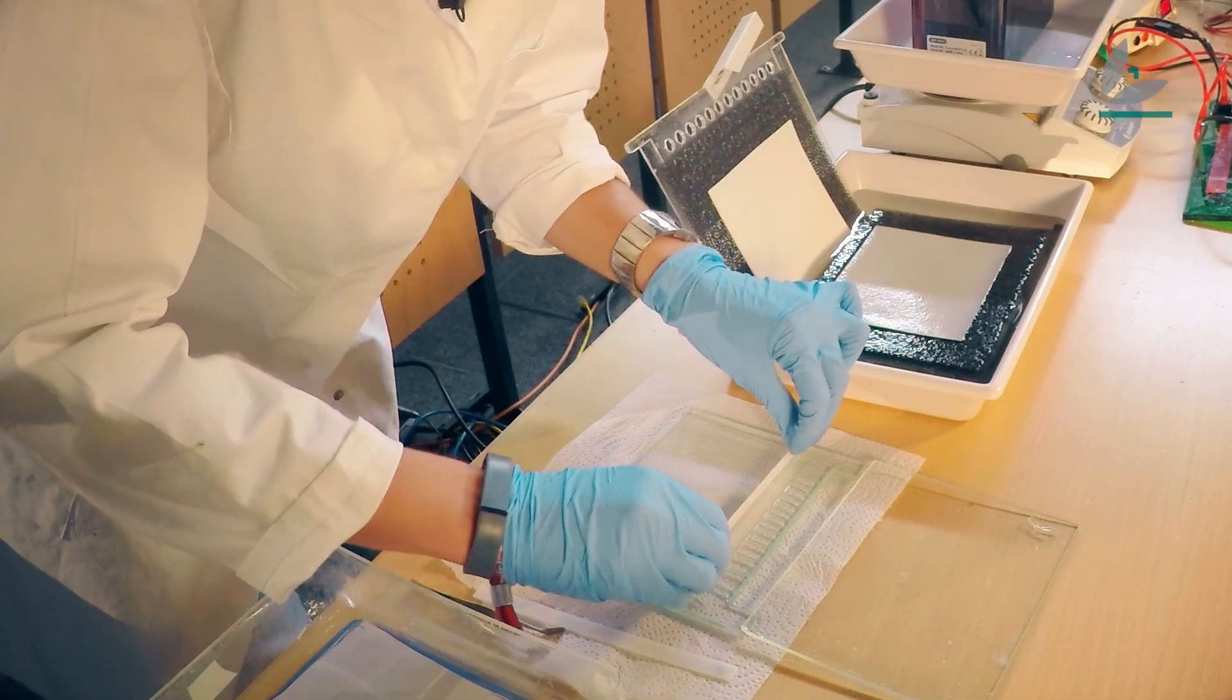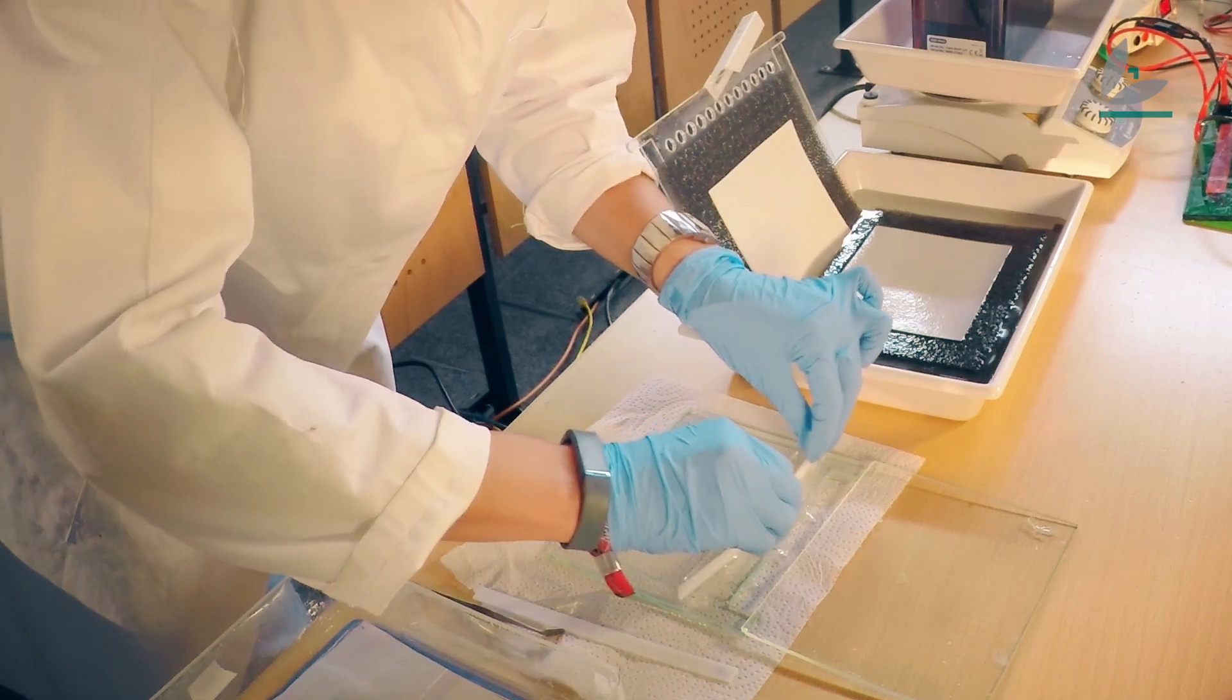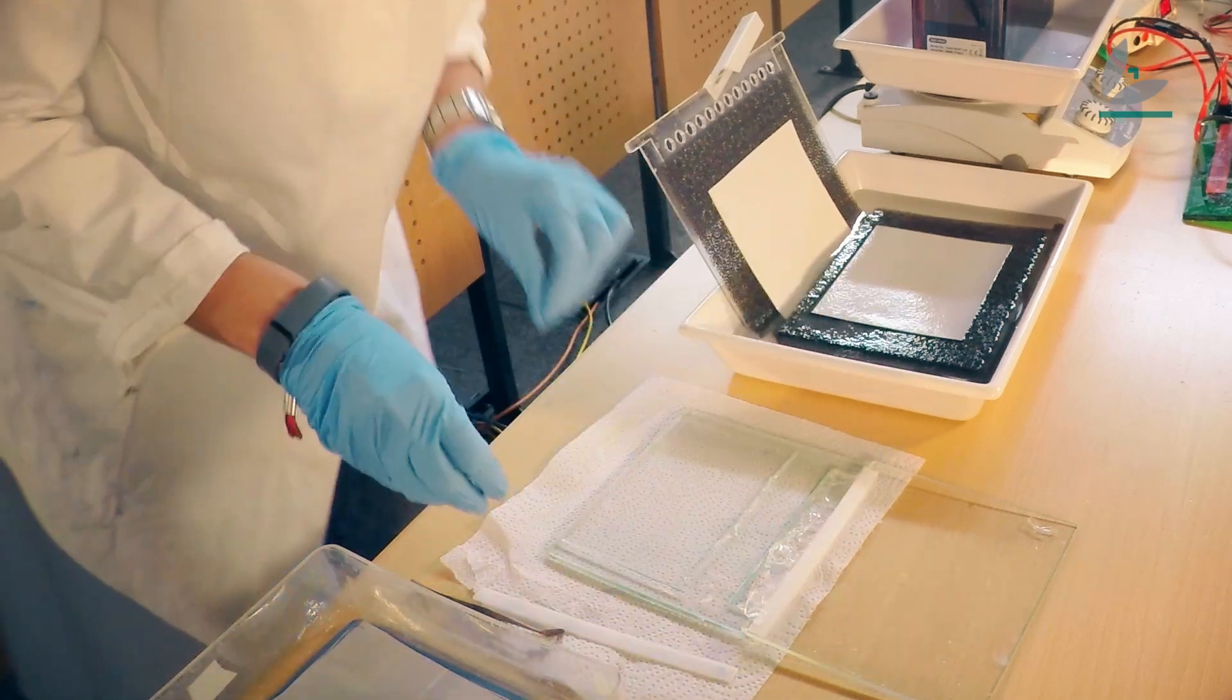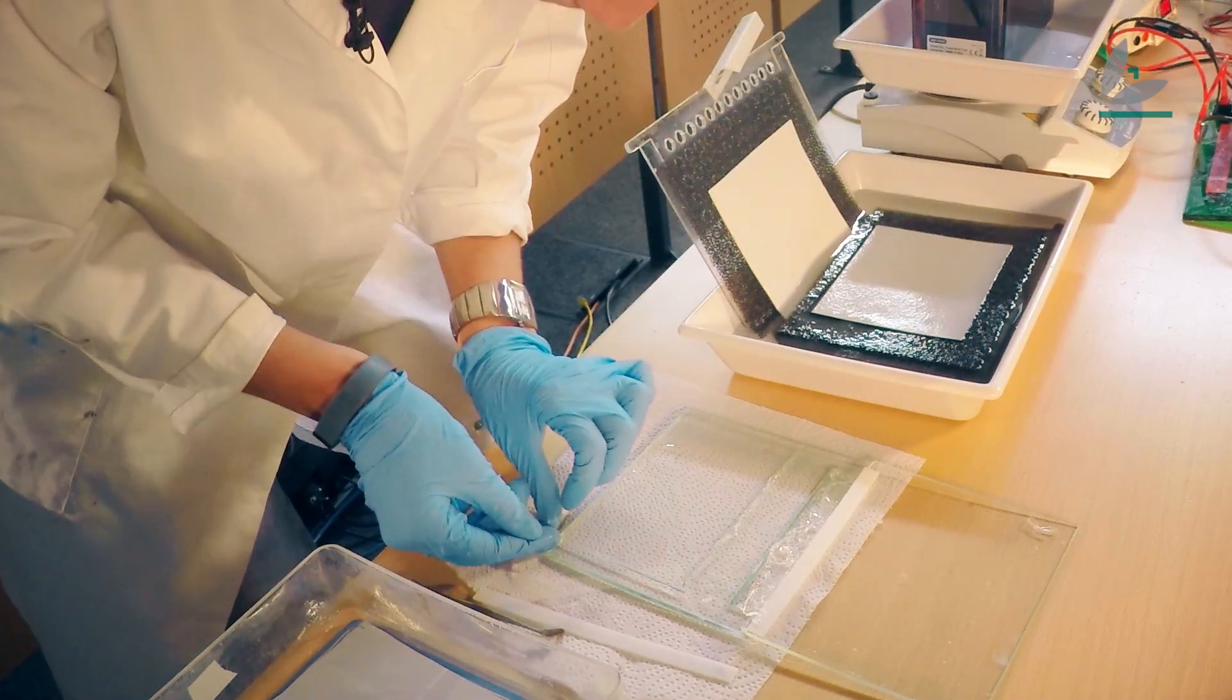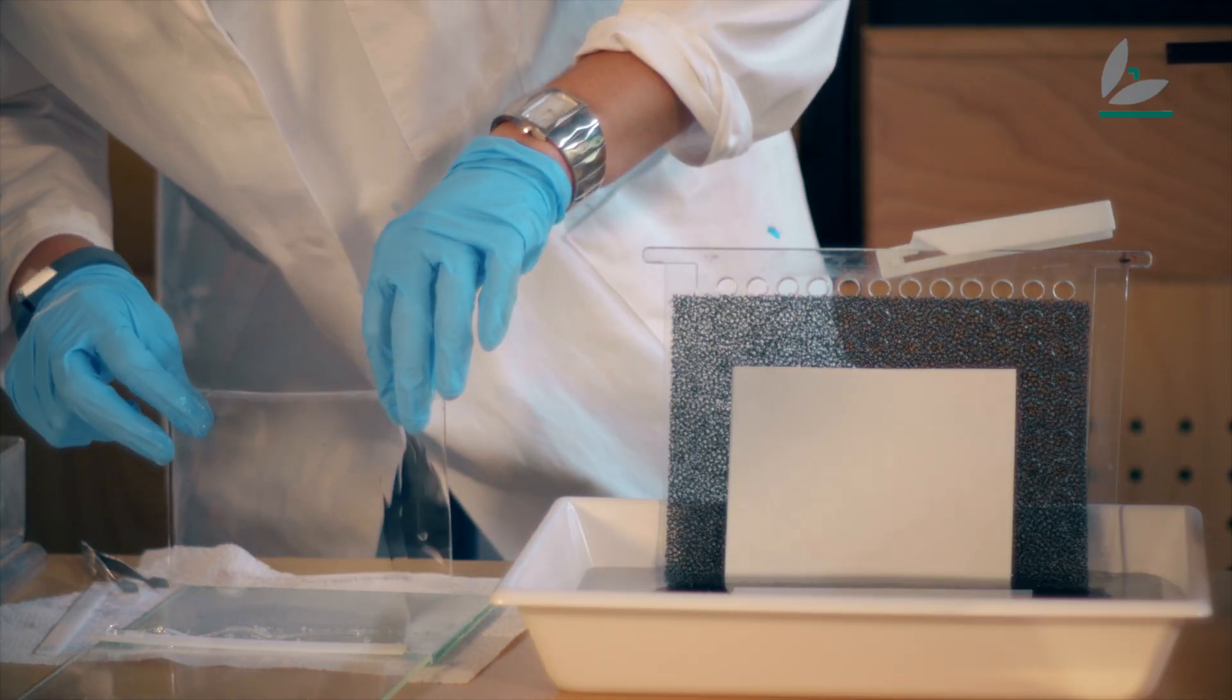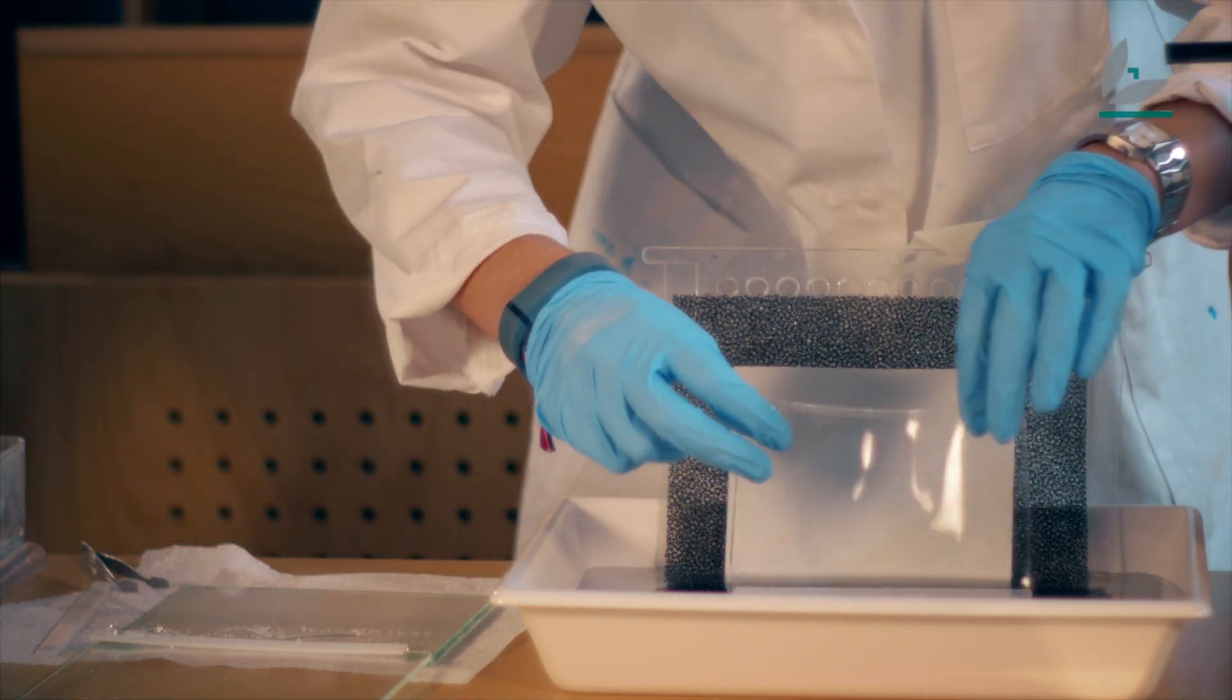So I'm going to take the gel out of the glass plates and put it in the transfer box. I have to be very careful because I don't want the gel to break.